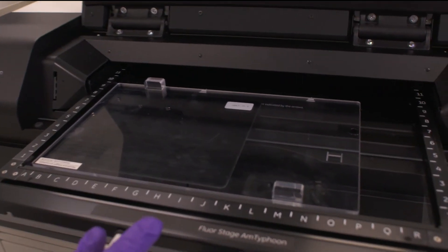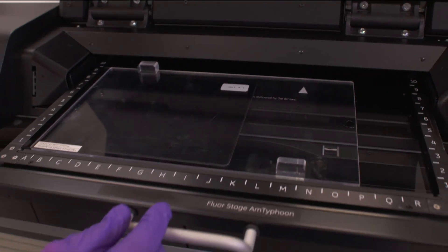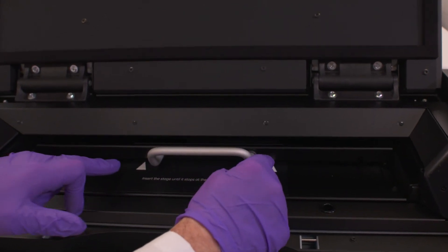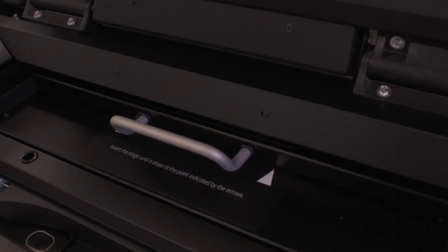In this case, we're just going to set it up like so. We're going to slide this to the top. Again, make sure that you see the apex of the triangle, and we know it's locked into place.